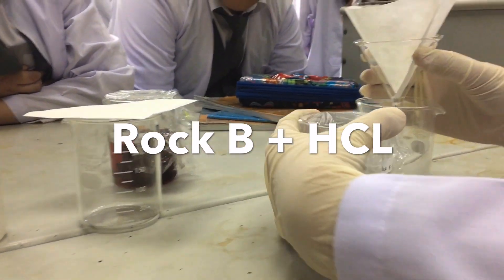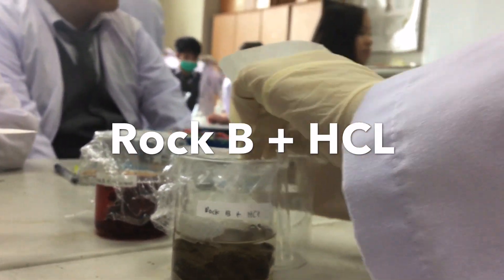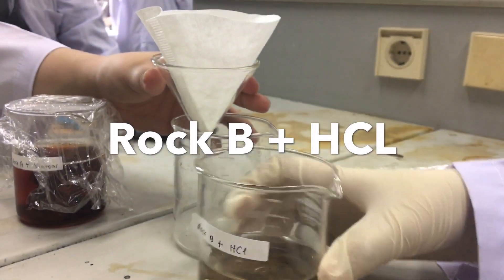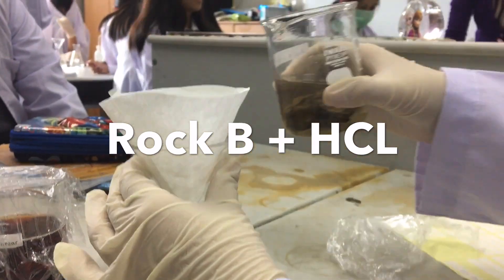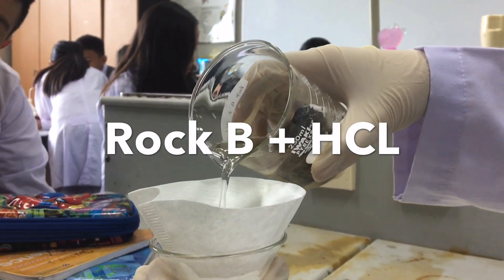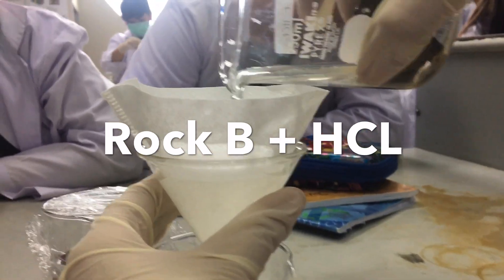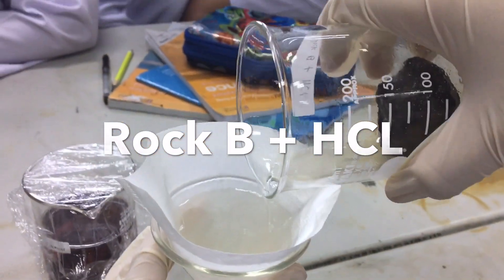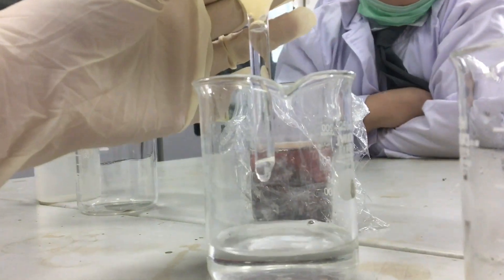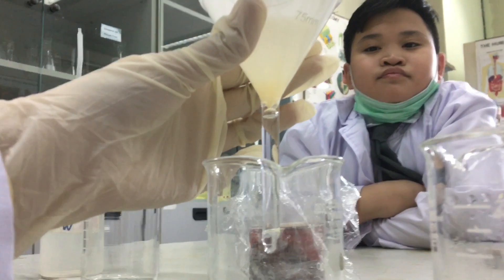We put the filter paper inside the filter funnel and put it into our beaker. Then we take our rock, the one with hydrochloric acid. We're going to open it and pour it into the bowl.